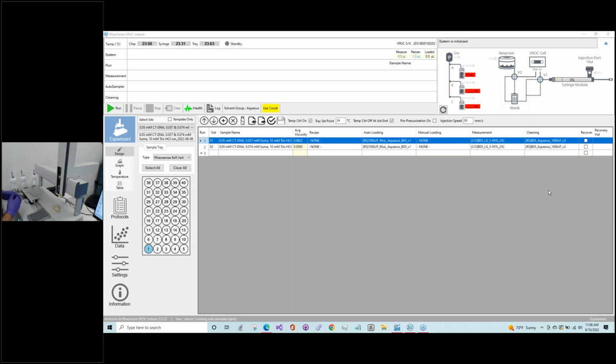Let's see. Another thing I like to do when I come in is open the hood over here. I want to make sure that my syringe is dry and empty and that there isn't any liquid in it. That could be indicative of a few other maintenance issues, which we can discuss later on. So I want to make sure the syringe is dry, and I want to make sure the line on the chip is dry.